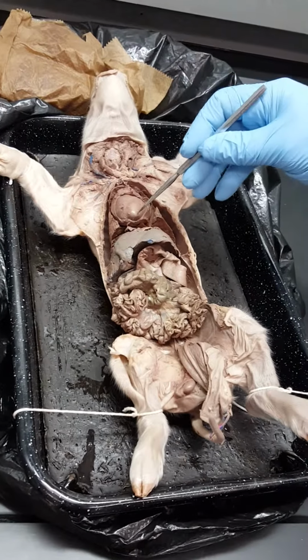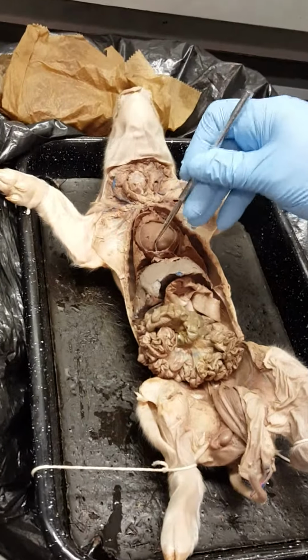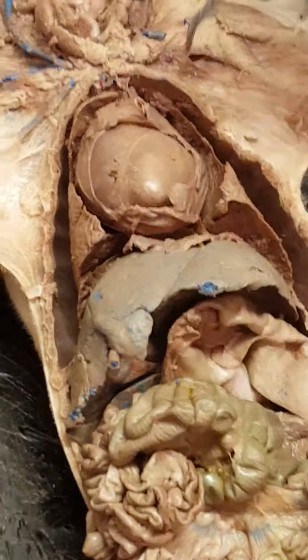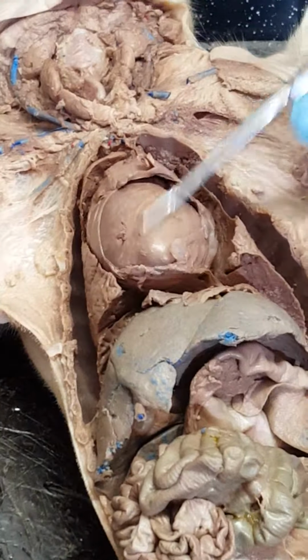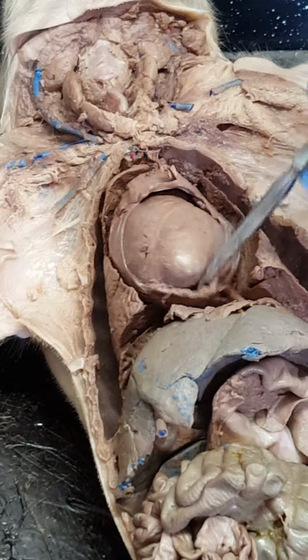Okay. So again, what you can't see clearly, this is the actual pericardium right here. You can see that membrane. That's your pericardium. Everyone sees that, right? Yes. And if you saw a sticker or some sort of thing on the surface and were asked what membrane covers that, it would be the visceral. This one that's furthest away would be the parietal.